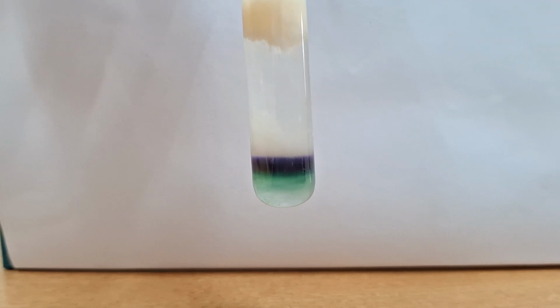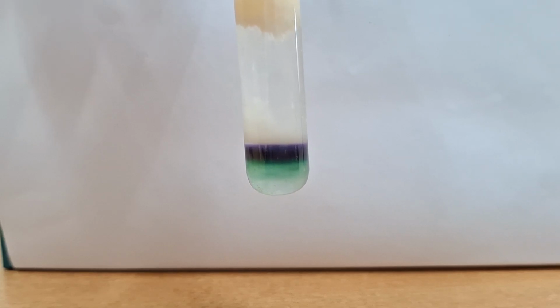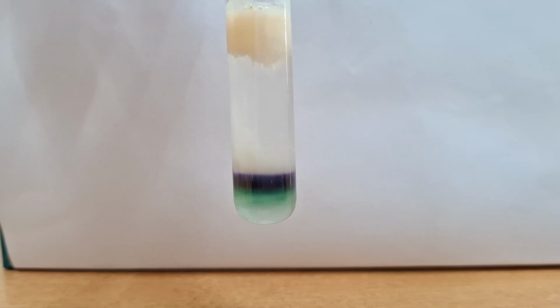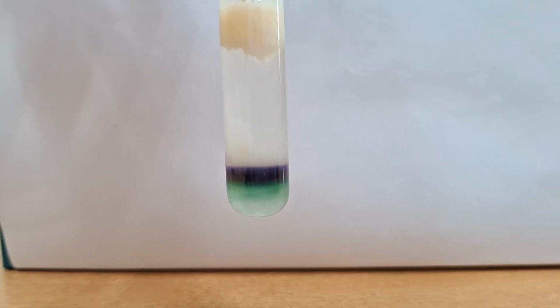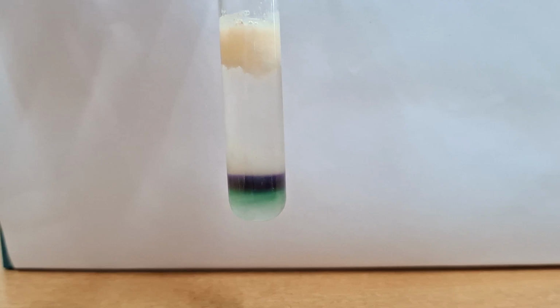Glycoprotein shows this test positive. Some proteins, for example albumin, contain carbohydrates like glucose and galactose as a prosthetic group, so this test is also positive for that particular protein. Thank you. I hope this practical is very clear to you. We keep this test in the spotting examination.